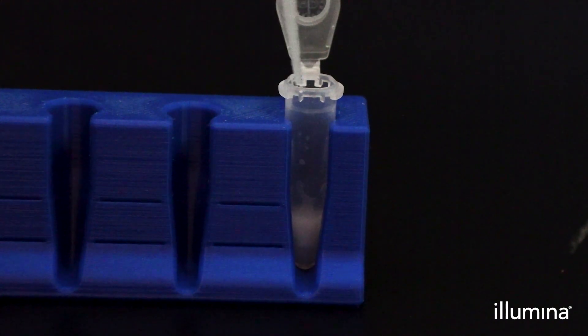Remember to wait five seconds prior to aspirating and wipe your pipette tip on the way out of the tube to prevent sample loss.